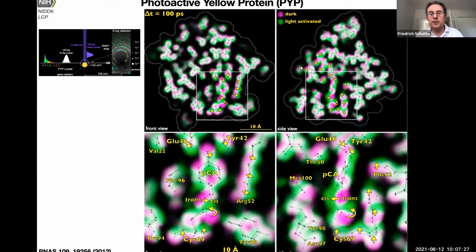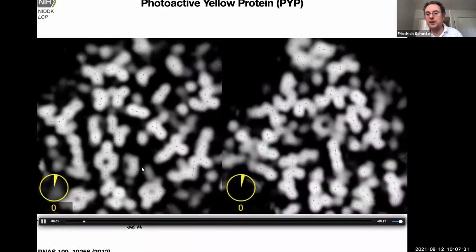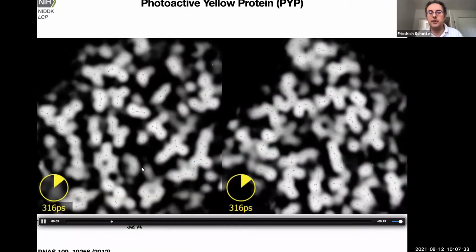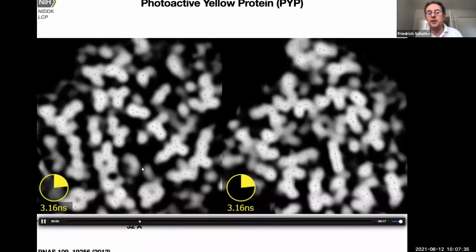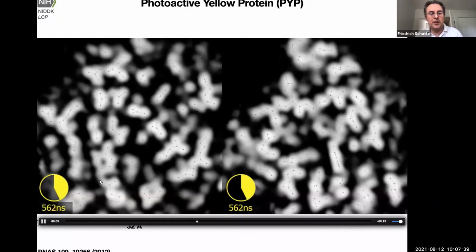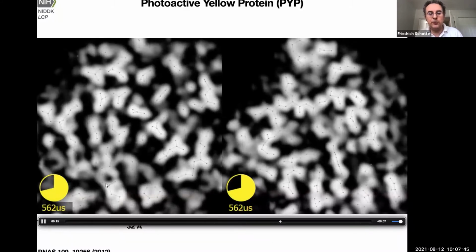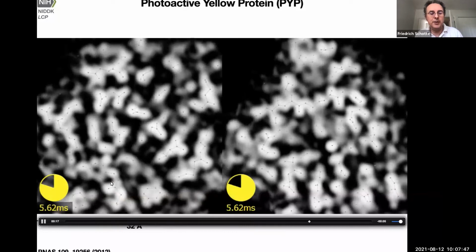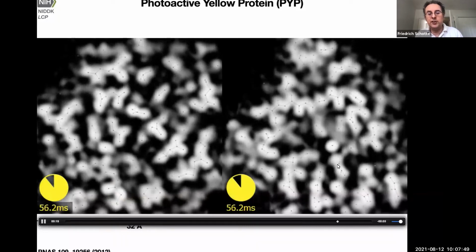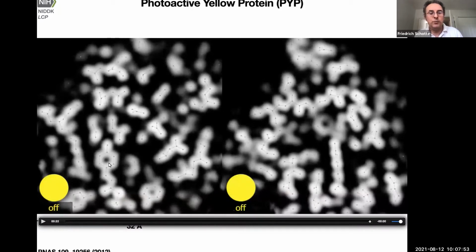And we took this further to make a movie out of the protein, how it undergoes its photocycle, which takes a bit shorter than a second or so. And you see 4 different intermediate states showing up as a function of time delay. So we're going on a geometric series of time delays, and we see different structures appearing at different times. So it's like a molecular movie of a protein in action.